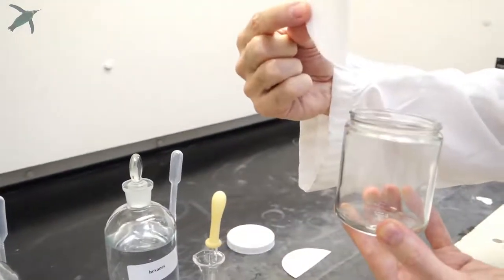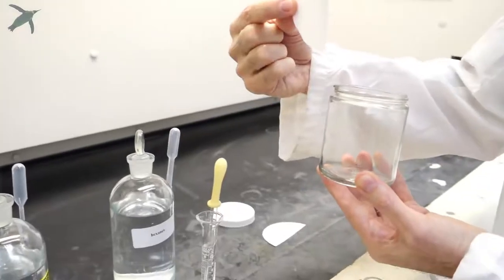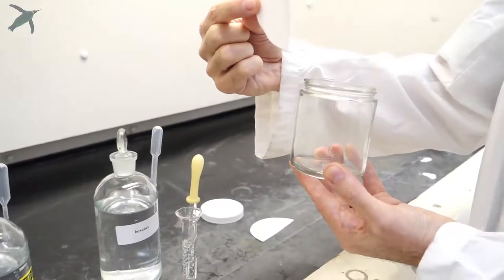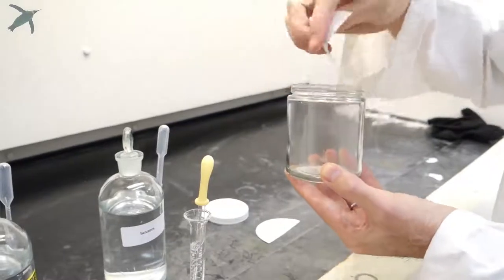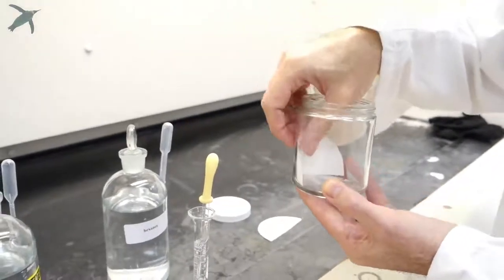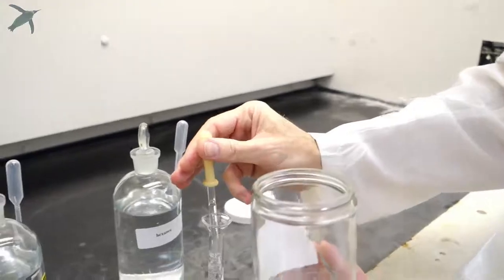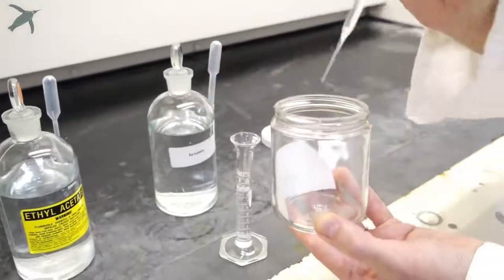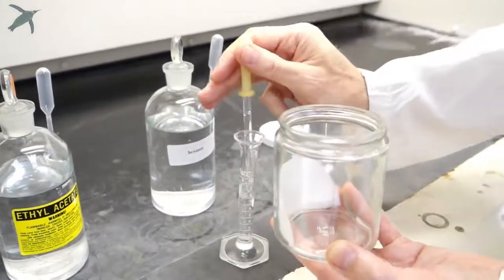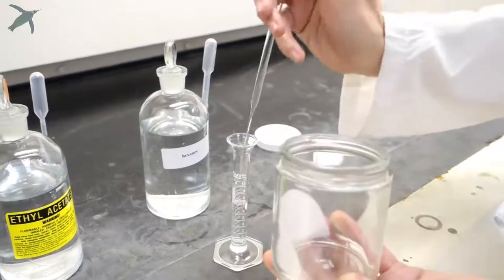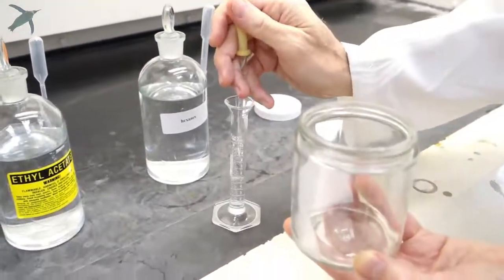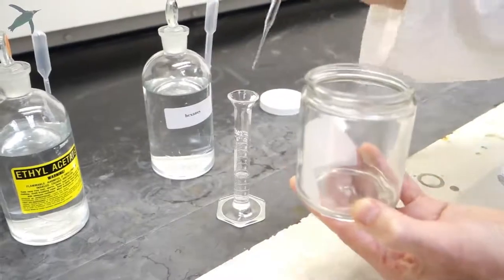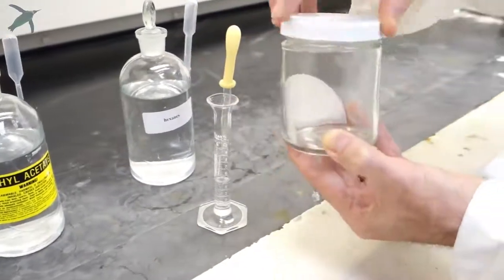I normally take a piece of filter paper that I split in half and put it in there. With your pipette, you wet the paper and put approximately 5-6 mLs of solvent in your chamber, then immediately reclose it.